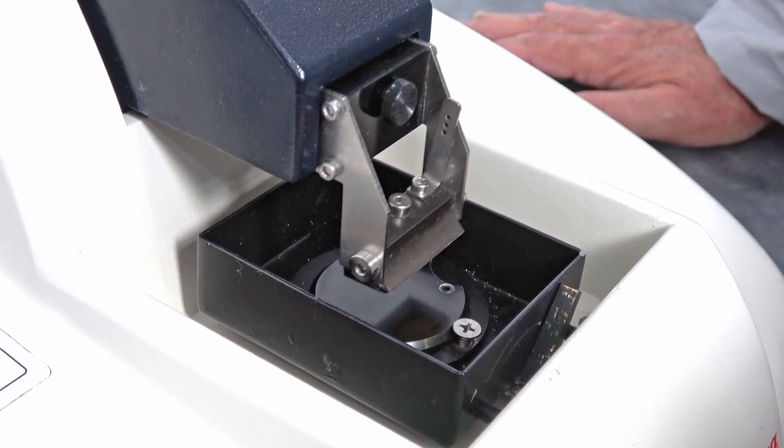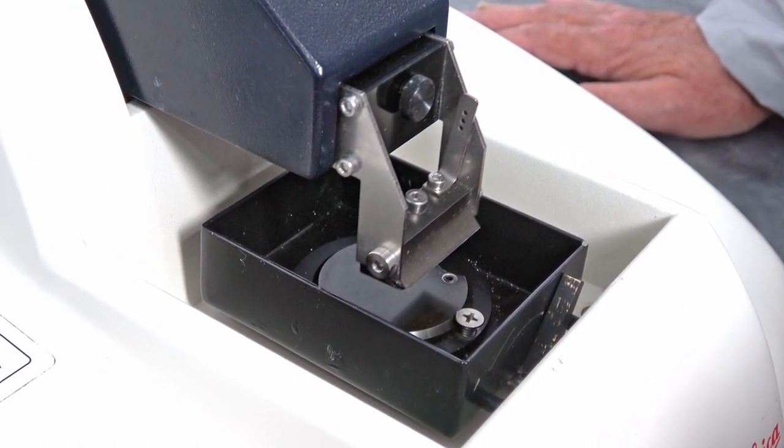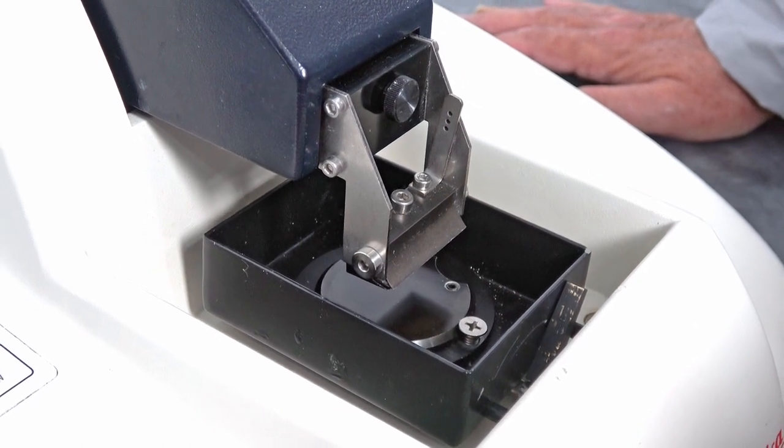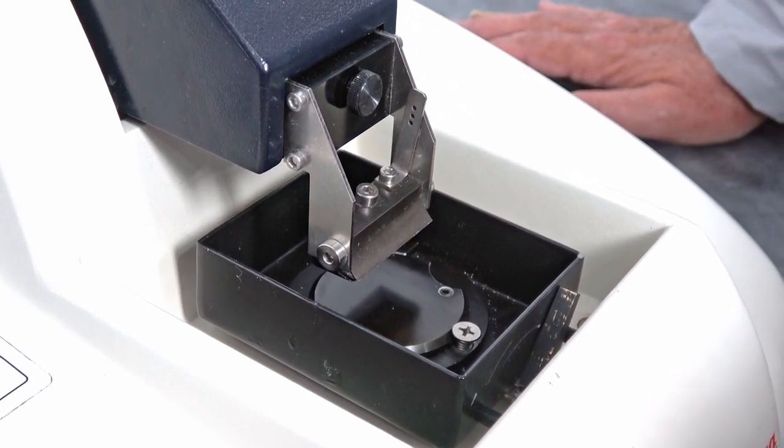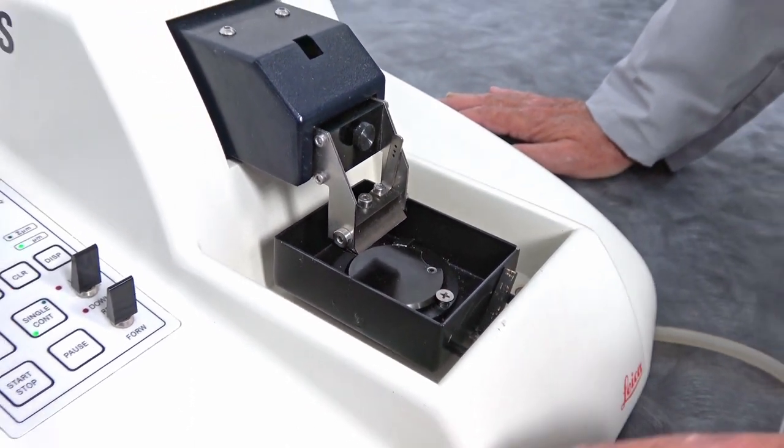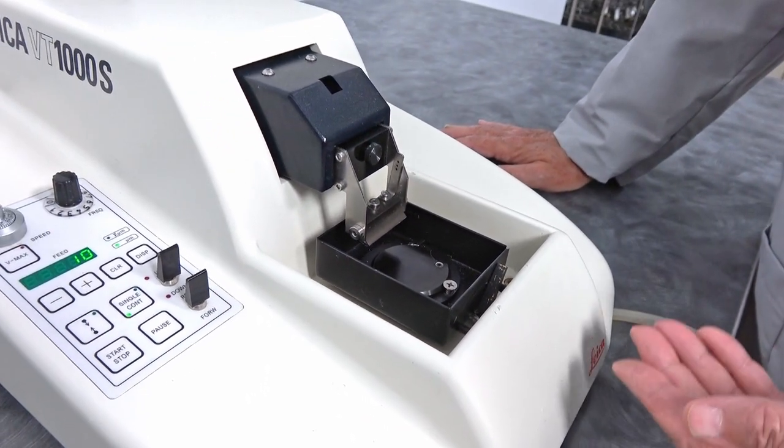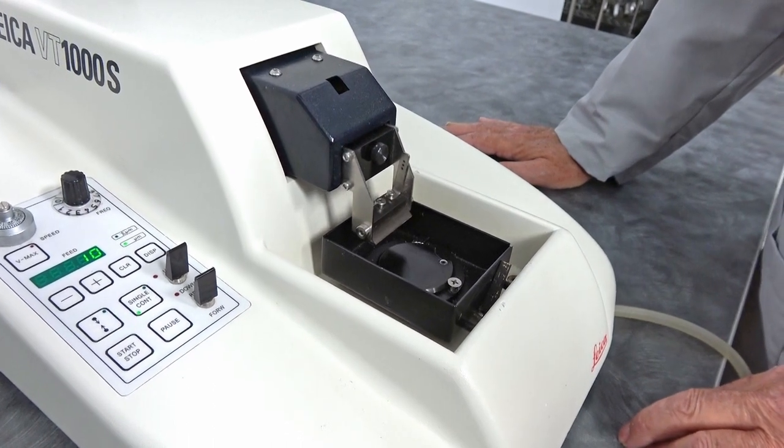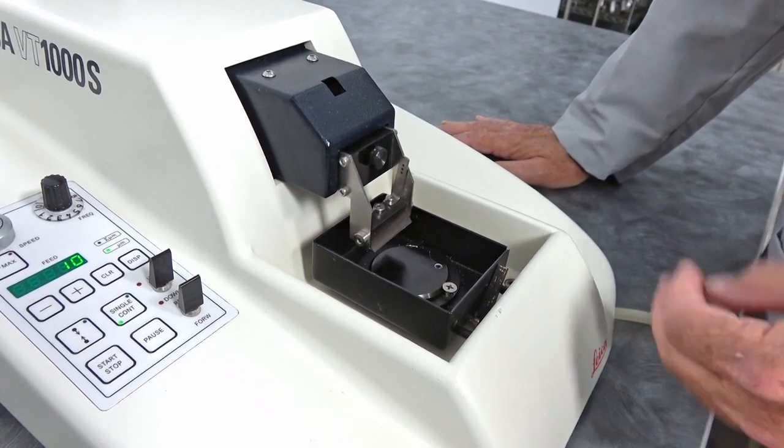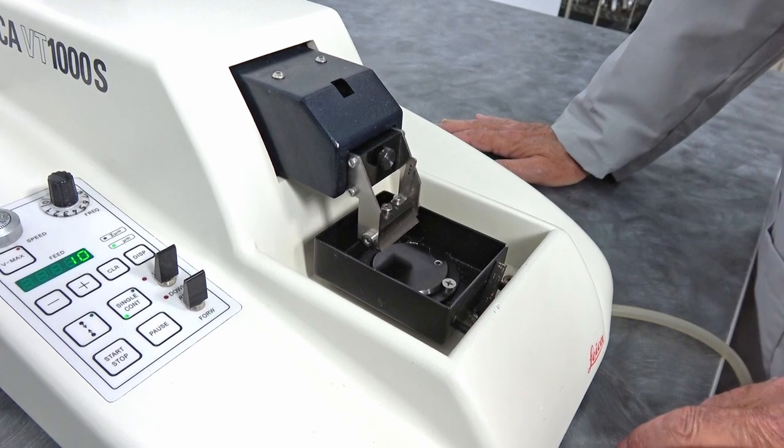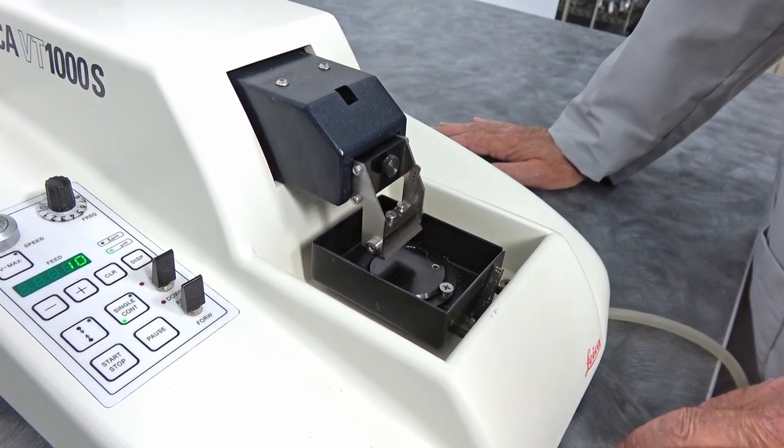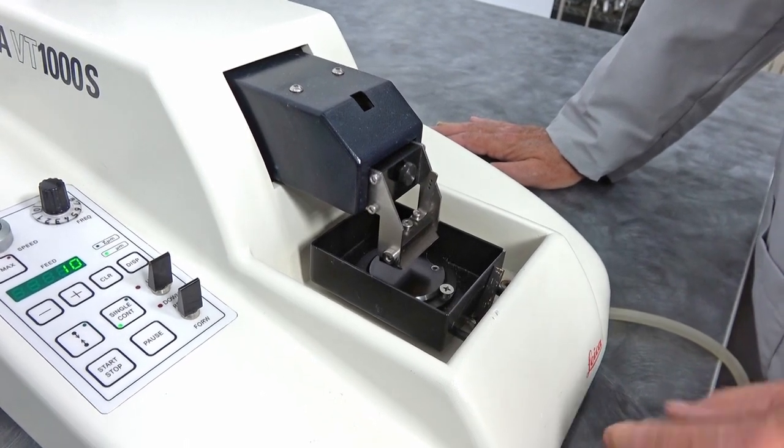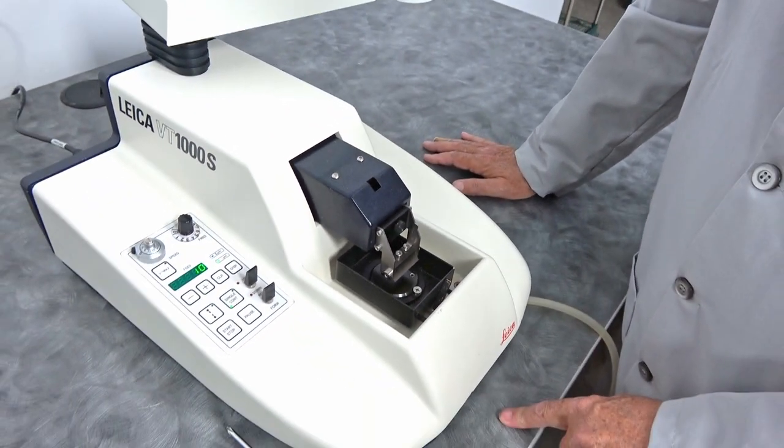It'll come to the end, retract the blade and then raise the stage and start again. Each time it will be cutting a section, or I should say trim for you, until you get to the area that you want to save, then you can be capturing your samples.